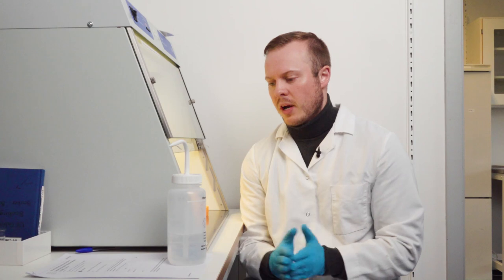And the last thing we need to do is actually mix the PCR tubes. So then we need to take it out of the UV cabinet. And then we will go to the PCR machine and start that.